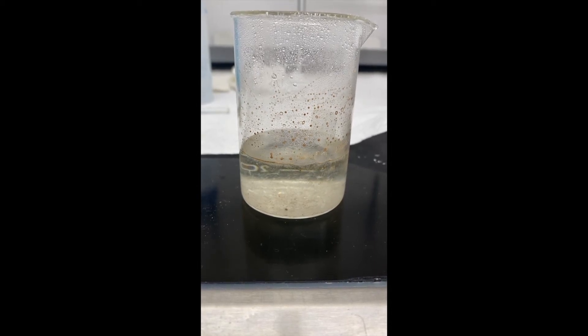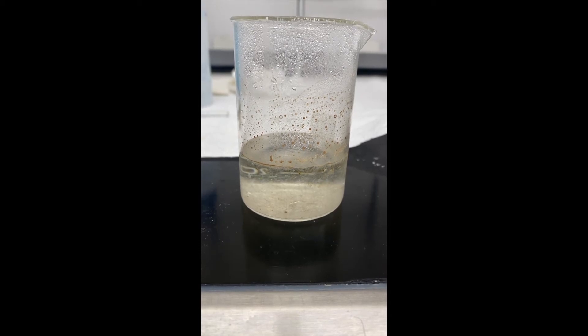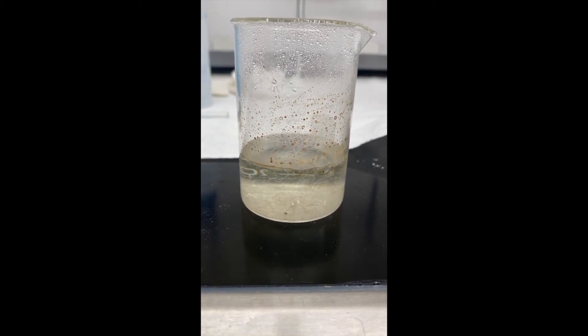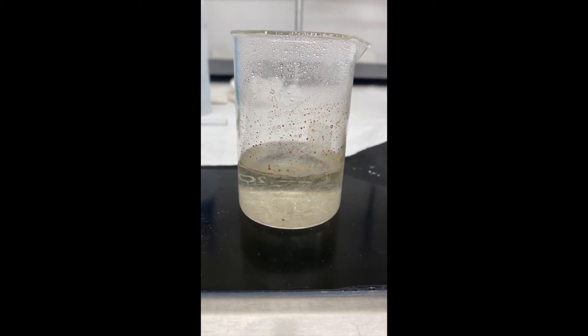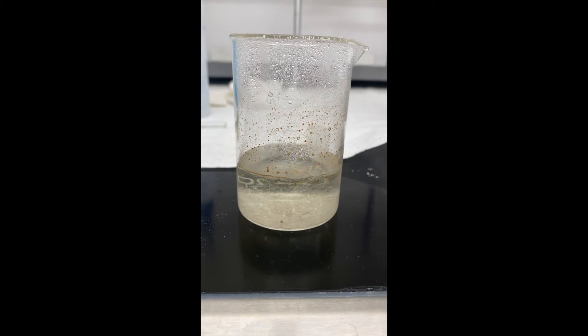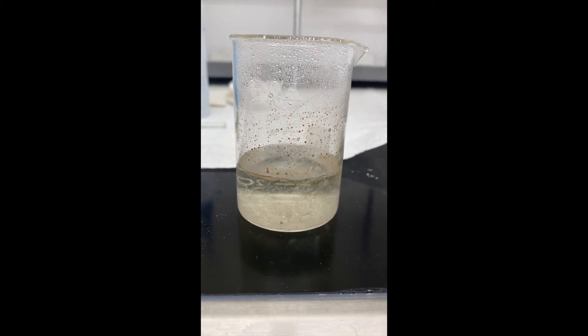If this crashed out really fast, then you can imagine impurities would get stuck in those crystal structures. So the slower, the better. And you notice you can make the relationship that the solubility of that solid starts to decrease as the temperature decreases. So we'll let this cool to room temperature.